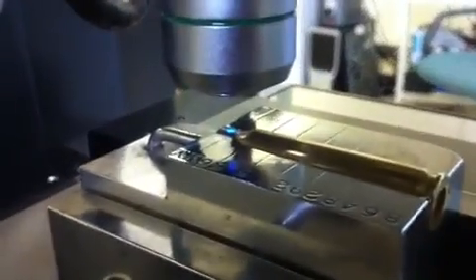Just trying to show the measurement capabilities here. It's auto-focusing. It's a nice indent. And this is the very last position. You can see now we're at the necking portion of the bullet shell. Back over to the software, and you can see the indentation is now automatically measured.